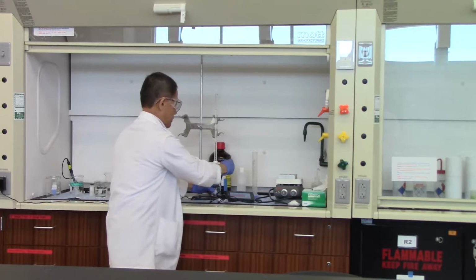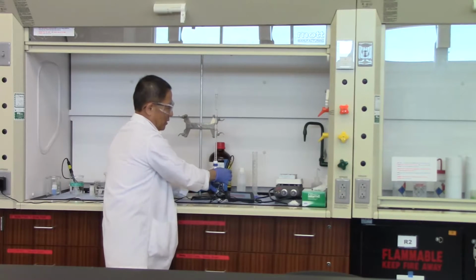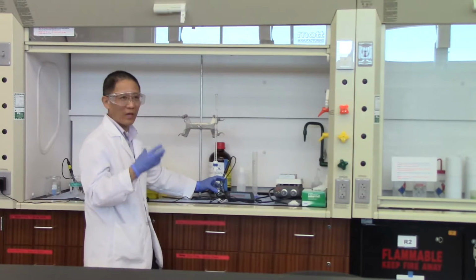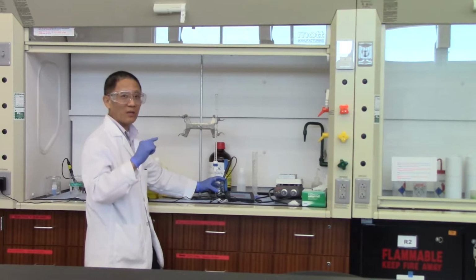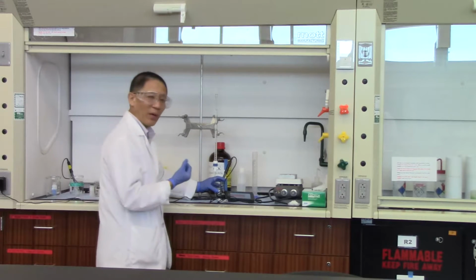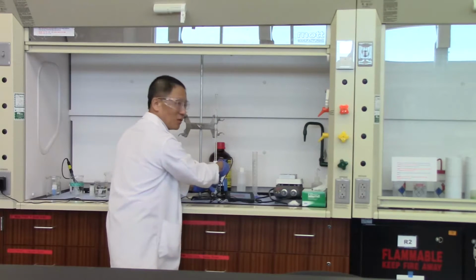Okay, so we put another milliliter of sodium hydroxide in, and we stir the mixture there. Okay, and the pH still stays in the 4.5 range. So now by adding 2 milliliters of sodium hydroxide, we see the pH actually went up by half a unit. We'll keep adding sodium hydroxide until we have a 2-unit jump. We do another milliliter here.